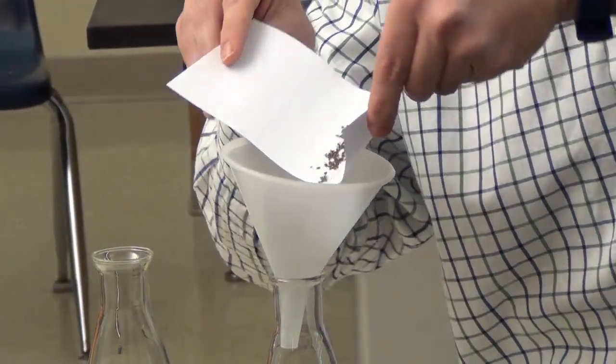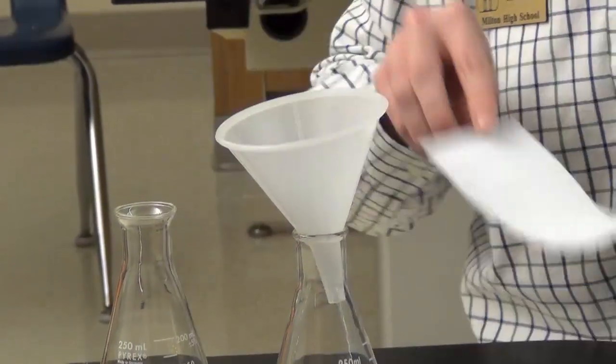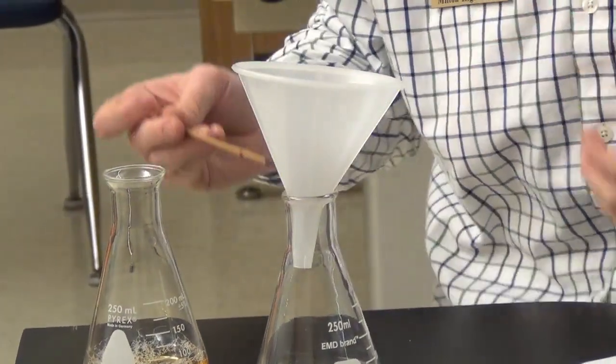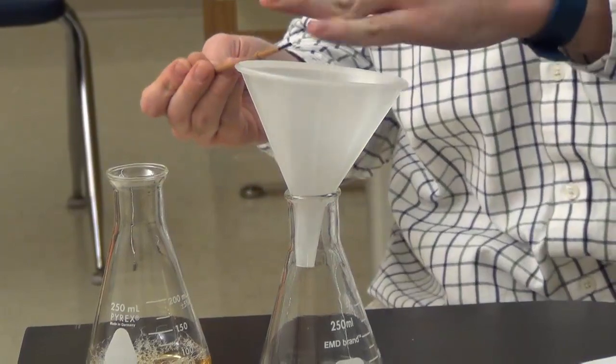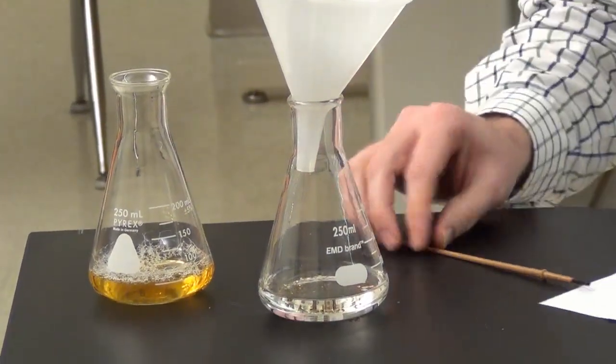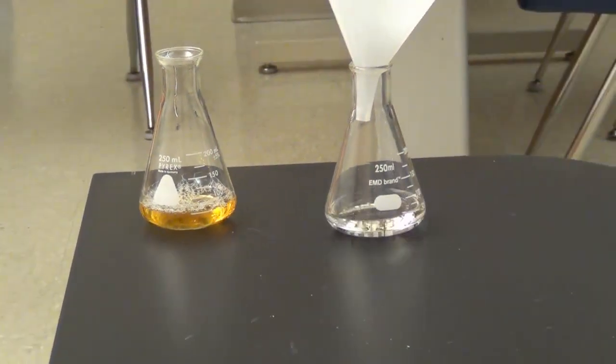So if you have flies left over, we're just going to kill the rest of the flies in this flask of rubbing alcohol. So you'll just dump them down there and make sure that they all get in the rubbing alcohol. If any flies happen to get away from you and they wake up, that little flask of apple cider vinegar and soap will trap the rest of those flies, so you don't need to worry about them either.